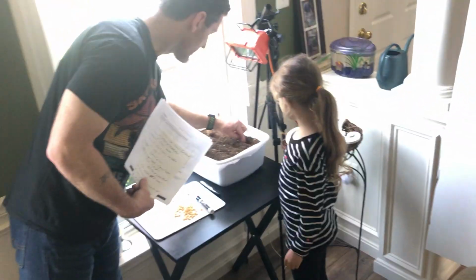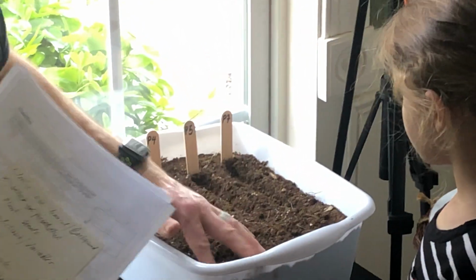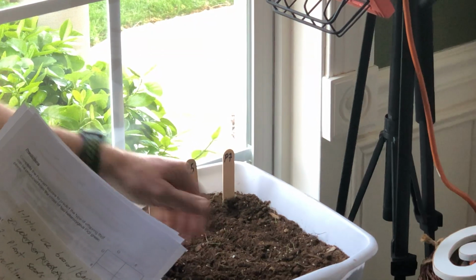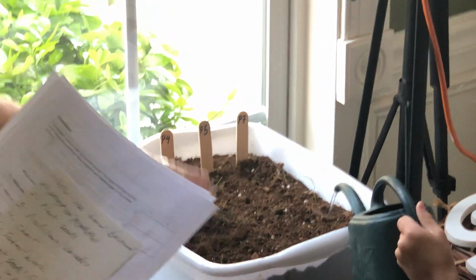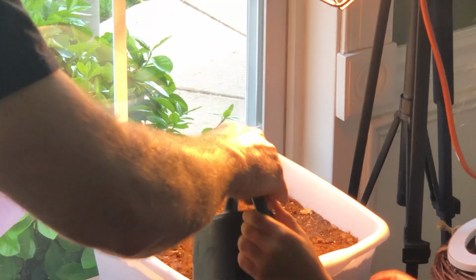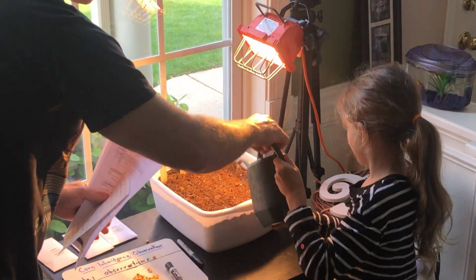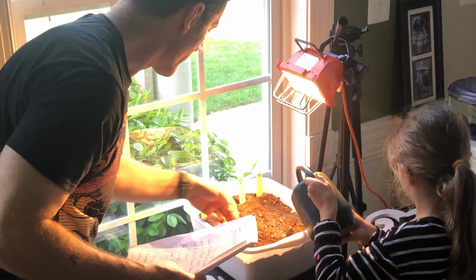Okay. All right. So now I'm just going to take this soil and we're going to go ahead and cover up our seeds. Alex, you want to get the water right there? And just water it down the row, like where you put the seeds. You know what I'm saying? Alex is going to go ahead and water it for us. I'm going to turn the light on. Nice and hot. Here we go. Just like this. All right. We don't need to put all of it. Just a little bit. We don't have to get it so super wet.